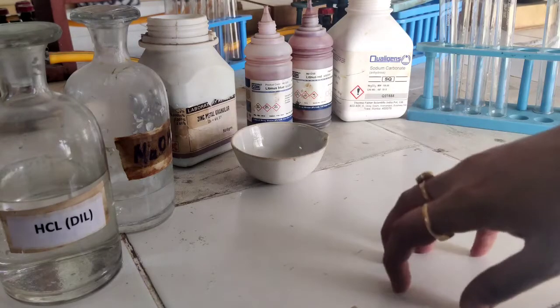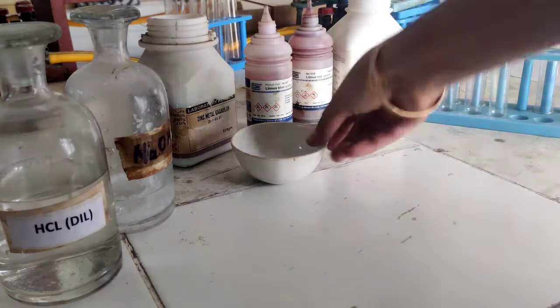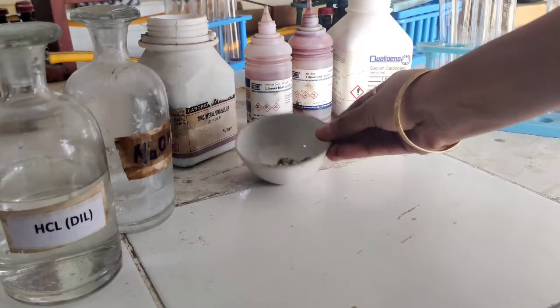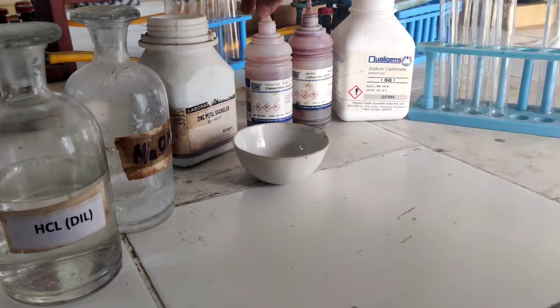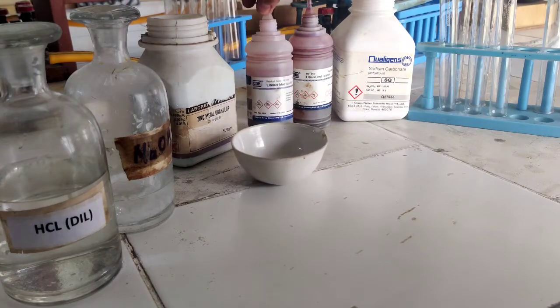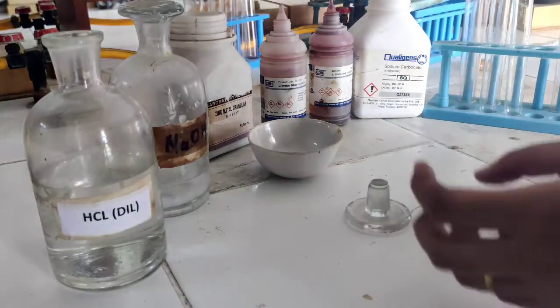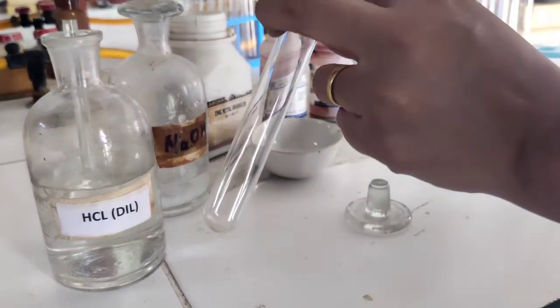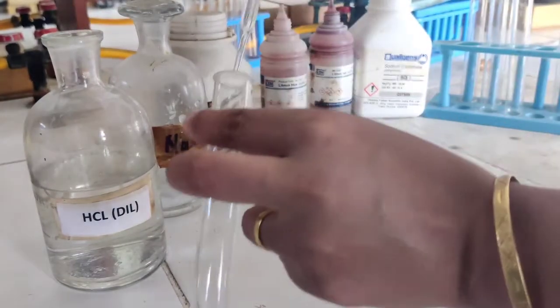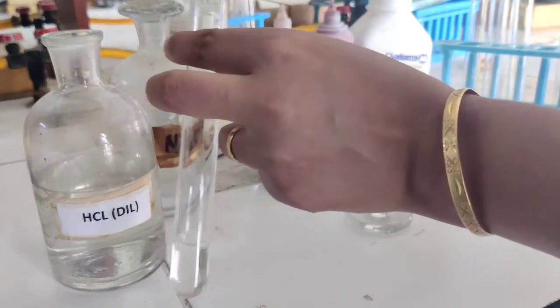In this video, we will discuss the reaction of HCl with zinc metal, sodium carbonate, blue litmus, and red litmus. First of all, take a test tube stand and place four test tubes in it. In each test tube, we will add dilute HCl.